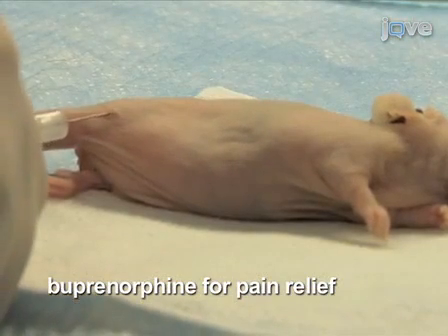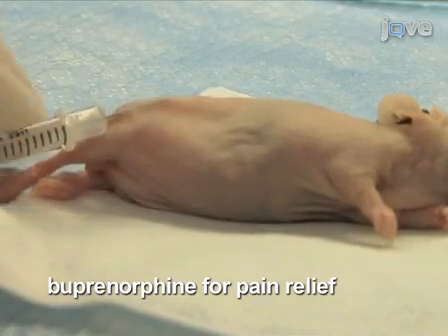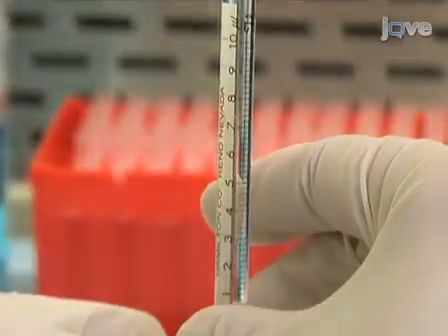Administer buprenorphine by subcutaneous injection for post-operative pain relief. Though not shown here, the buprenorphine is rapidly absorbed. Proceed to inject additional mice.